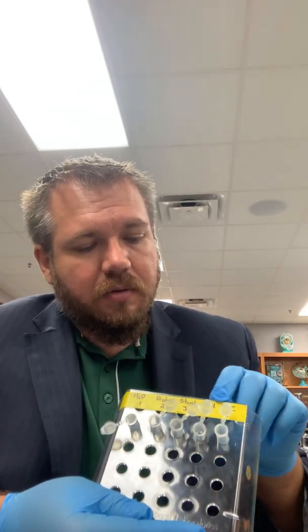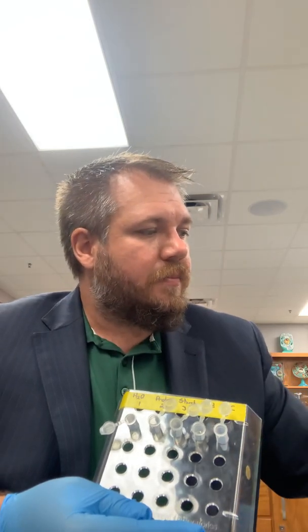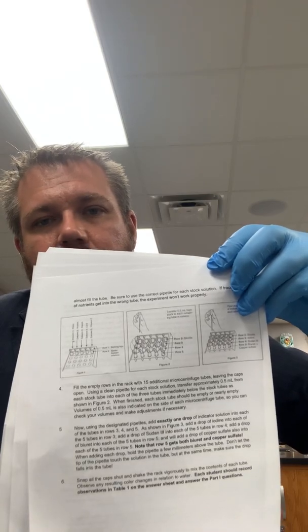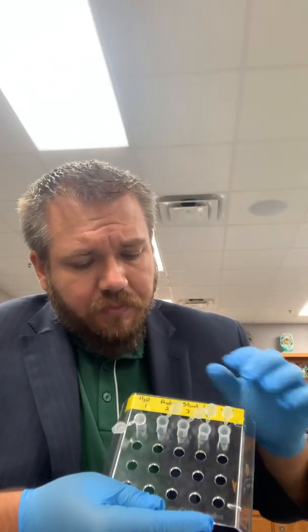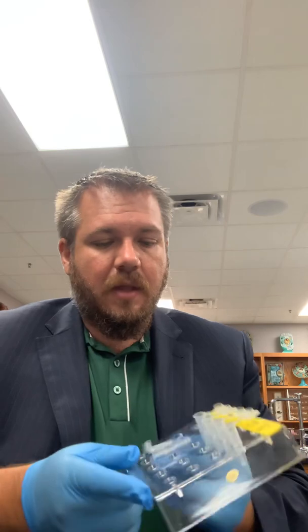right across the second row. So the first row is probably already going to be labeled. If it's not labeled, get some tape or ask your instructor for tape and label right across through there. You'll notice it should have a certain labeling scheme to it. Should be water, protein, starch, lipids, and vitamin C. Again, your handout shows that nicely in that figure right there. So it's going to tell you to label things that way. Again, they're probably already labeled. But right there in that row number 2, you're going to put your 5 microcentrifuge tubes.